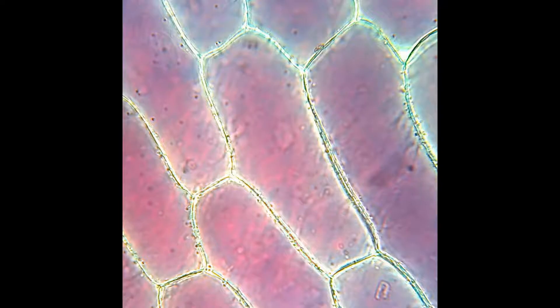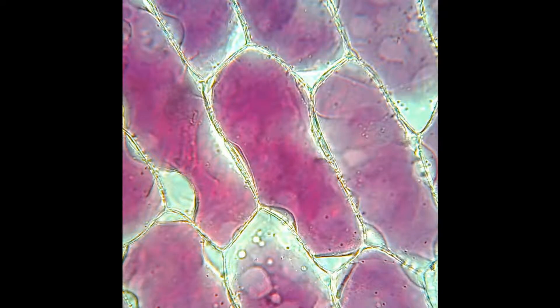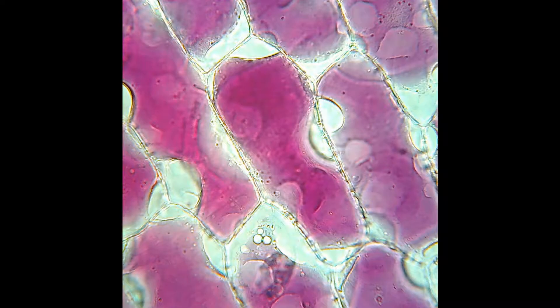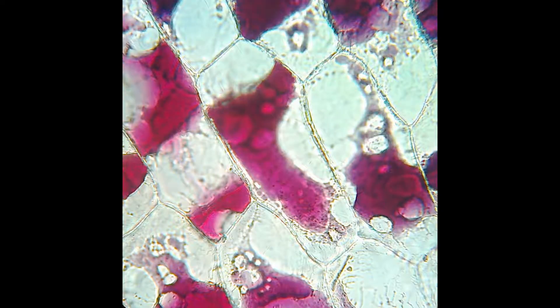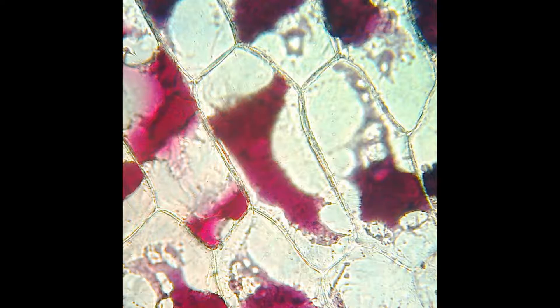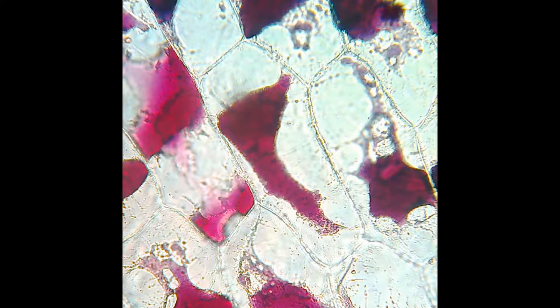Observe again under the microscope. You'll now see that as time progresses from seconds to minutes, the protoplasm within the epidermal cells begins to gradually shrink away from the cell walls. This is called plasmolysis and occurs as a result of exosmosis of the protoplasmic fluid from the cell to the exterior surroundings.